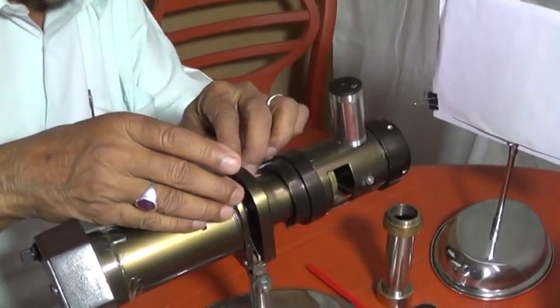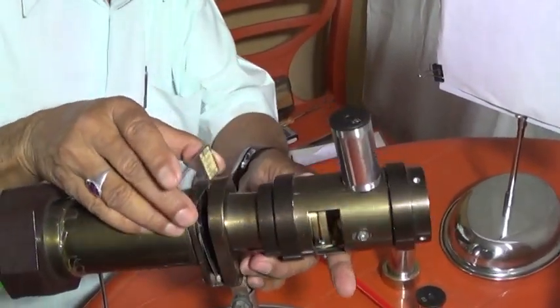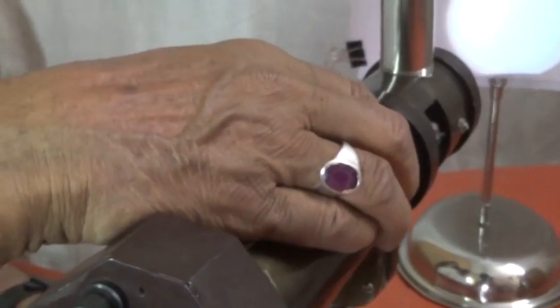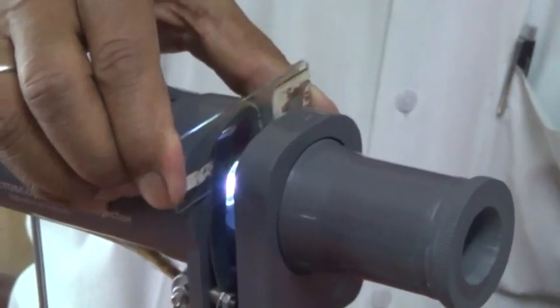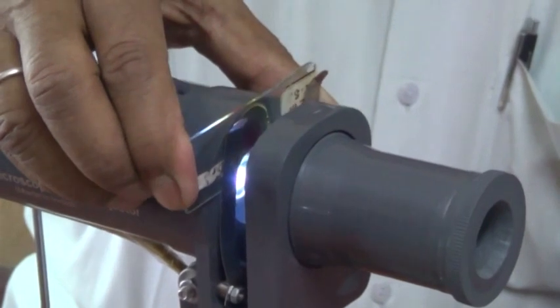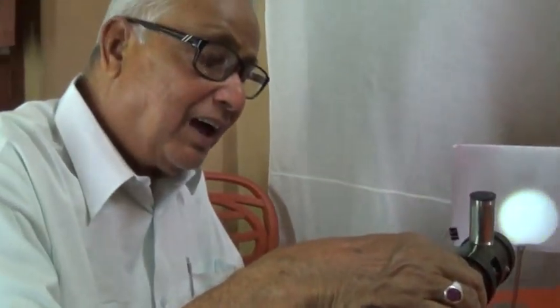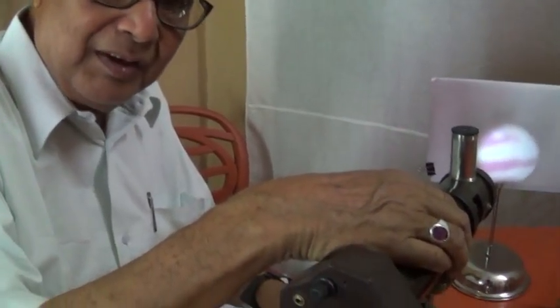I am inserting the slides within the two clips. This slide is to be moved horizontally and vertically so that the specimen is to be placed at the beam of light.